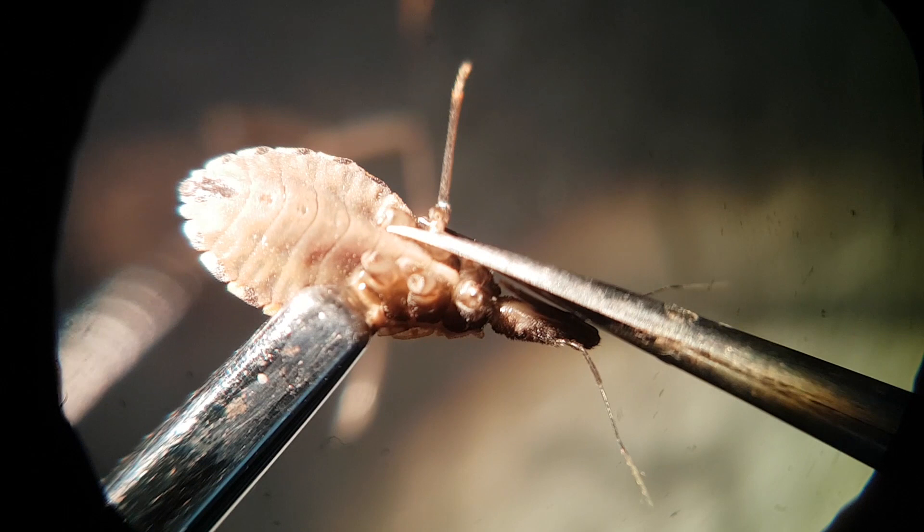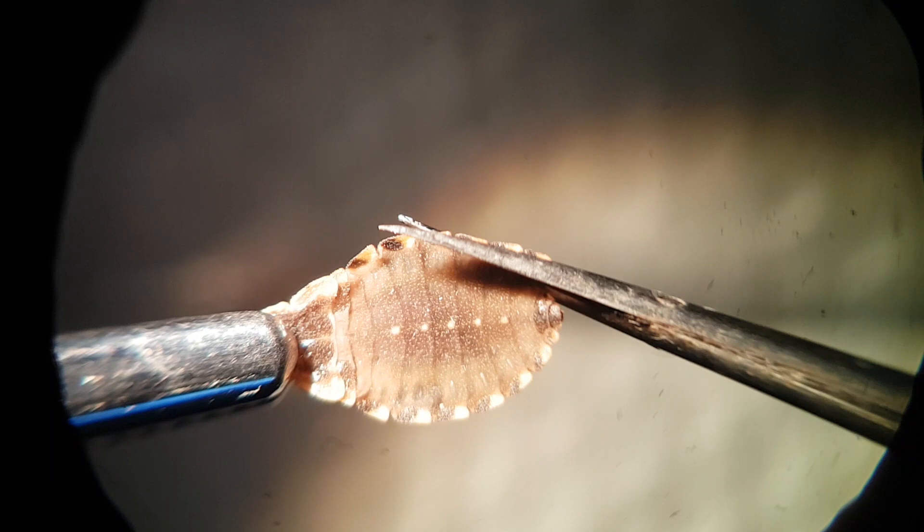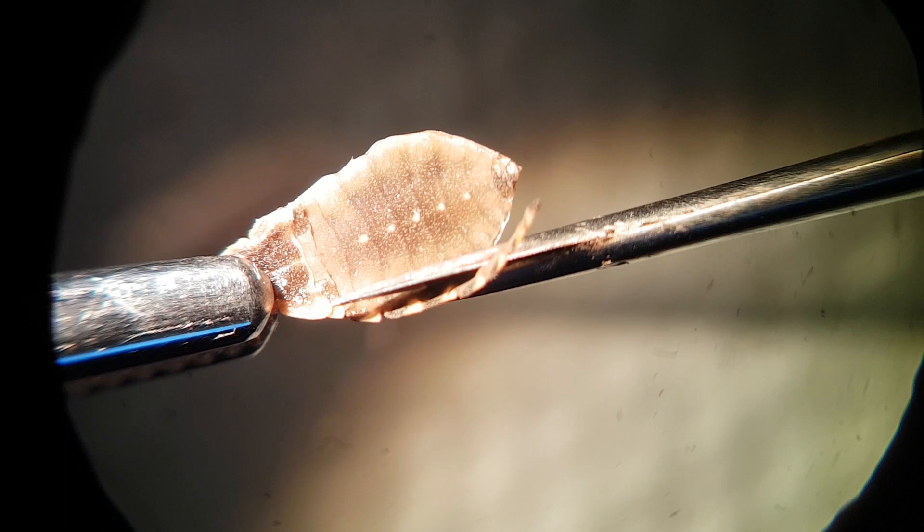Cut the head off at the neck joint. Cut the edge of the abdomen on one side up to the thorax, avoiding the anal segment, and then on the other side.